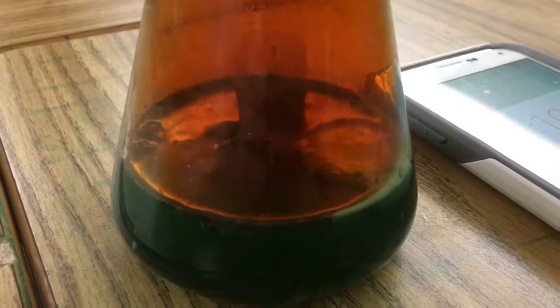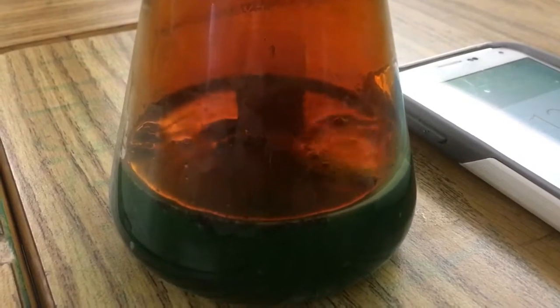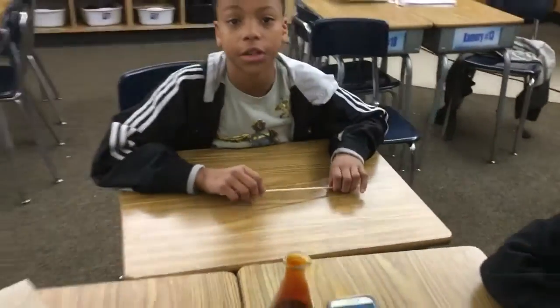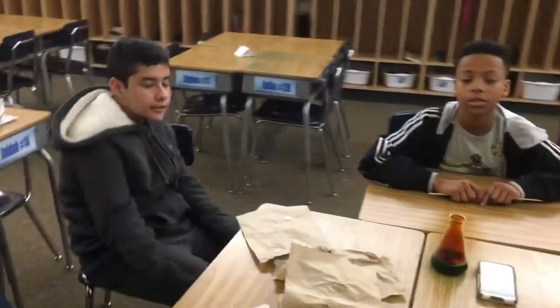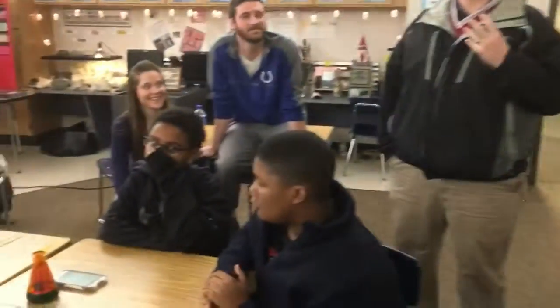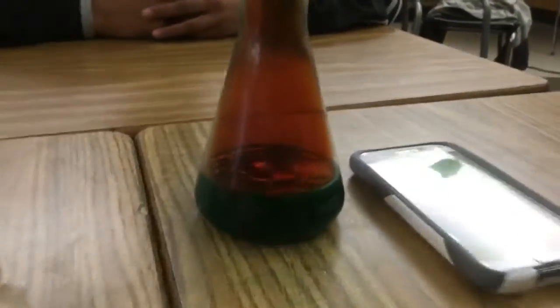Now we know that the law of conservation of mass and energy says what? It can't be created or destroyed. So where is this penny going? Where is it going right now? Into the atmosphere, and some of us are going to breathe a little penny today. Some of it's going to go out the window over there. Some of it's going to go out the door over here. Mr. Weisenbach is going to probably smell a little bit of that penny. Breathing penny.